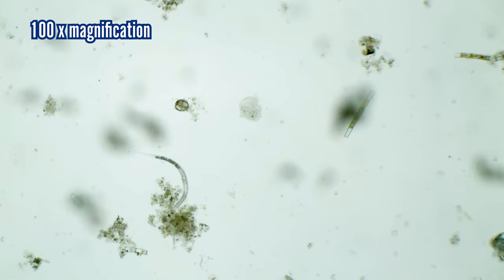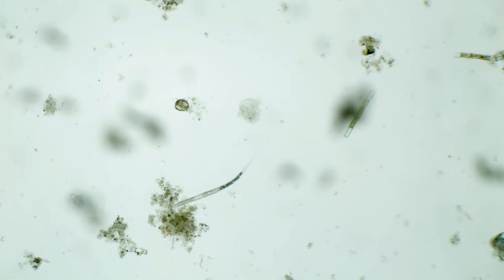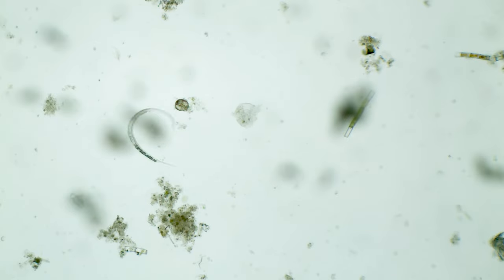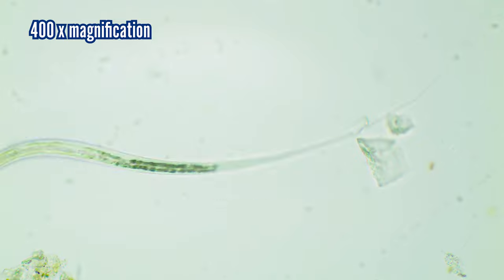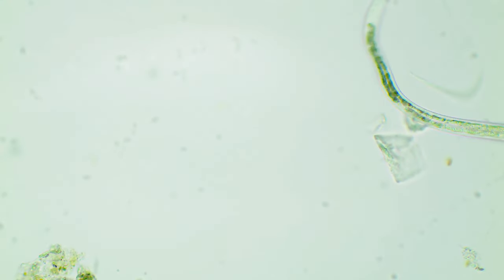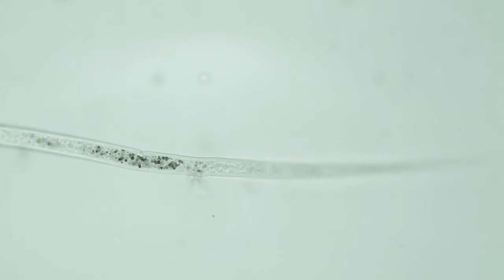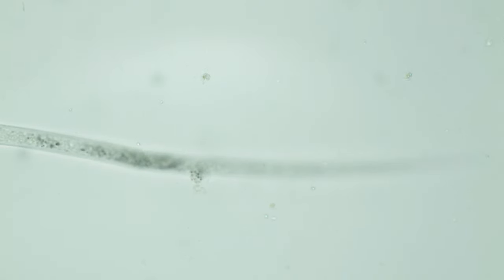The second inhabitant was this aquatic roundworm. It is most likely a member of the nematode species, and it is not alone either — I found around three of them. When I speed up the footage, the roundworm reminds me of an aircraft marshaller. When the microorganism is dead we can enjoy its transparency to the full extent — is this considered a privacy violation? Don't sue me, little worm, please.